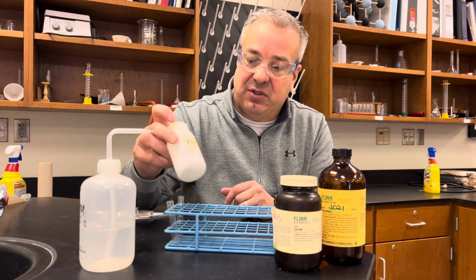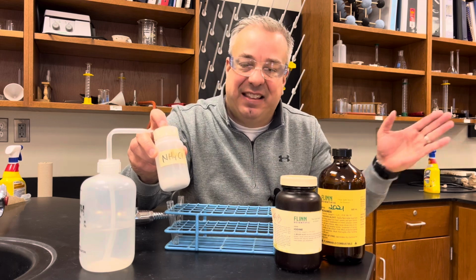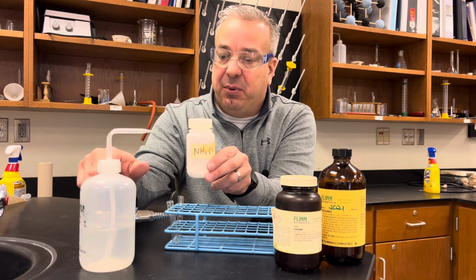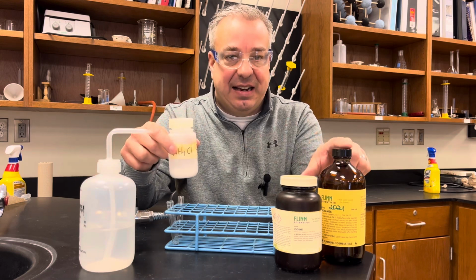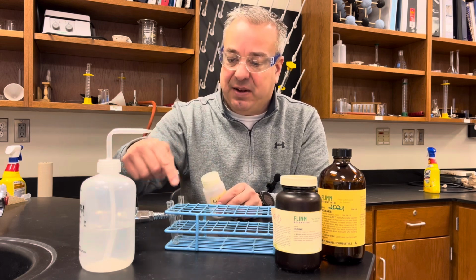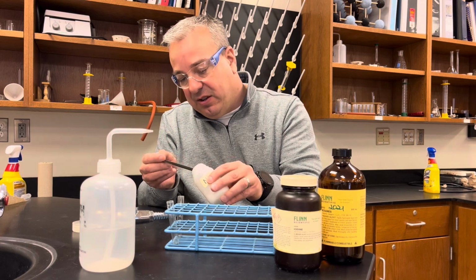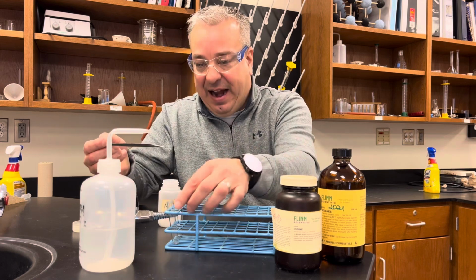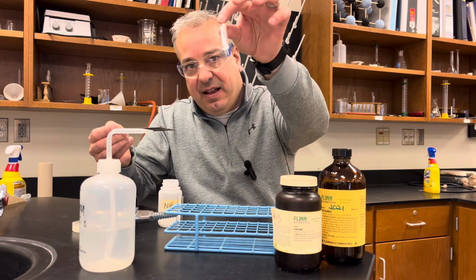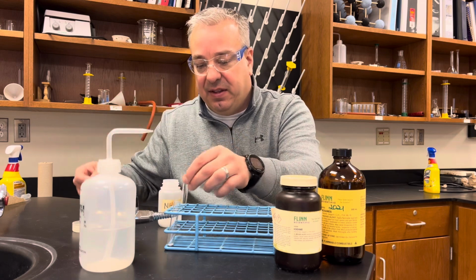So in this demonstration, I have ammonium chloride, which is an ionic compound, which is like the extreme case of polar. So it should dissolve in the polar solvent and not in the nonpolar solvent. Okay, so let's go ahead. I'm going to put equal amounts of ammonium chloride into each of these test tubes. So I'm just going to take about half of this and put it into one test tube. Okay, and then I'm going to take the other half and put it in this test tube.